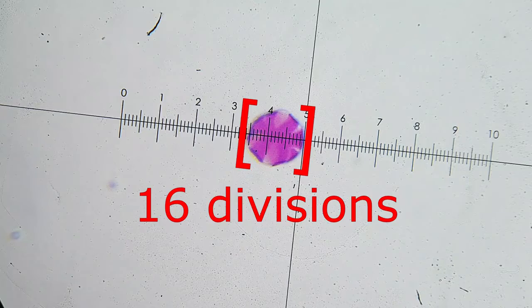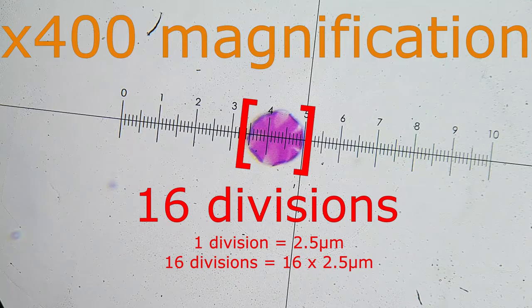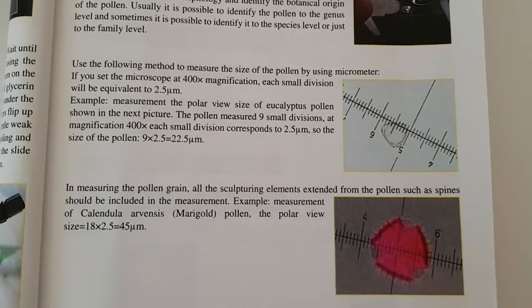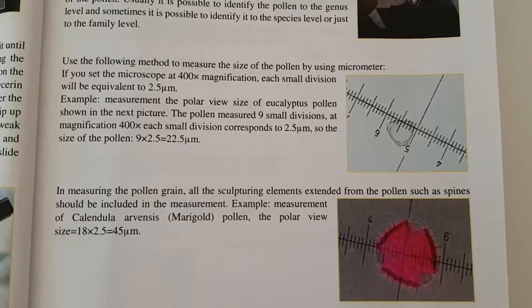Okay, so what type of pollen is it? The pollen covers 16 divisions using the micrometer. I have set my microscope at 400 times magnification. Each division is equivalent to 2.5 micrometers. So the size of the pollen is 16 divisions times 2.5 micrometers. That gives us 40 micrometers. This book gives you a very easy calculation you can work out in order to identify your pollen.